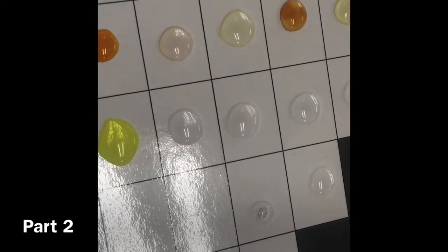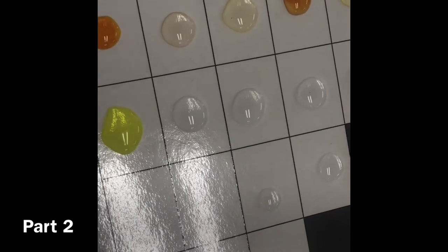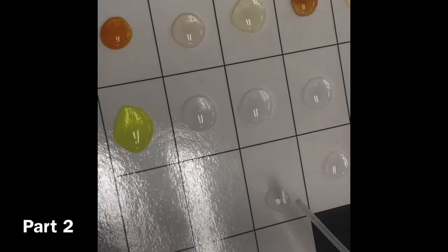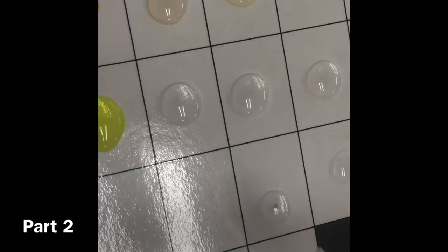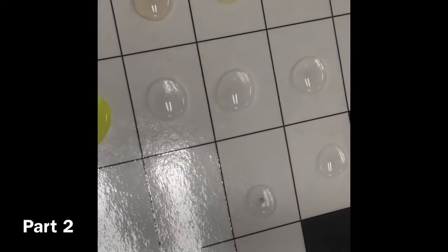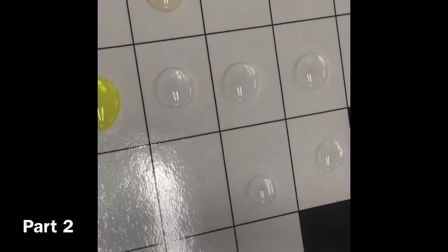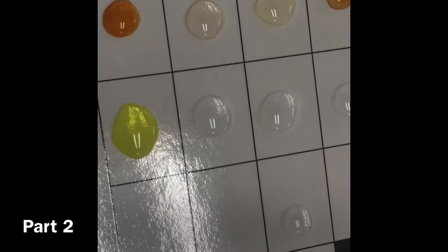So it's kind of like two different types of iron, but they produce the same thing. There's two different types. Nothing happened. This is ridiculous, you guys. Nothing's reacting.